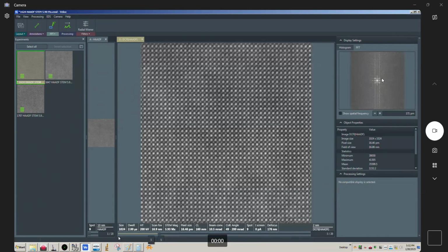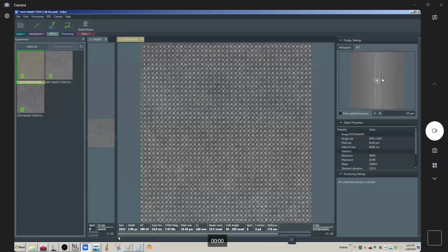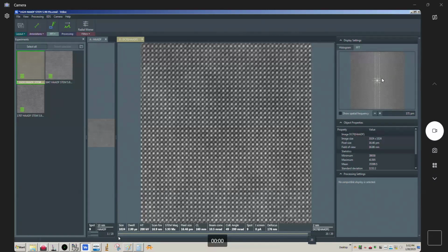Okay, so it's adding together better in some parts than other parts of the picture, okay? And clearly it looks better down here than it does up here. I hope you can see that, okay? So it's not doing the frame integration perfectly, okay?